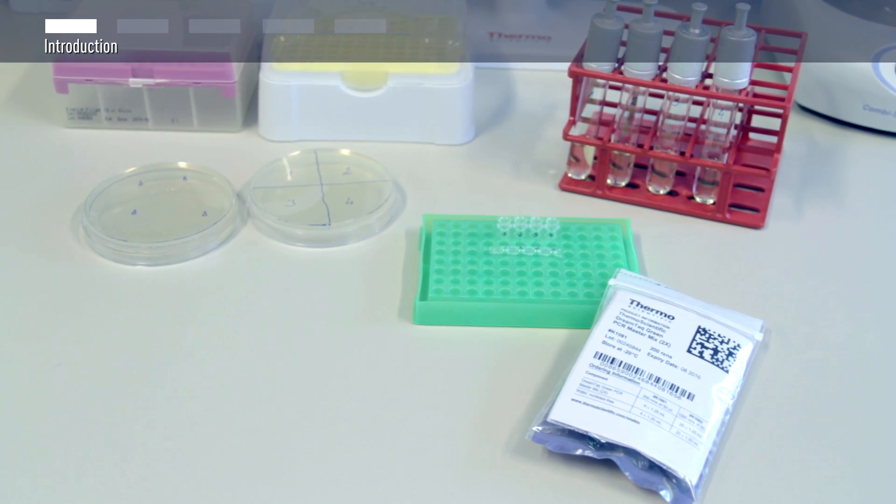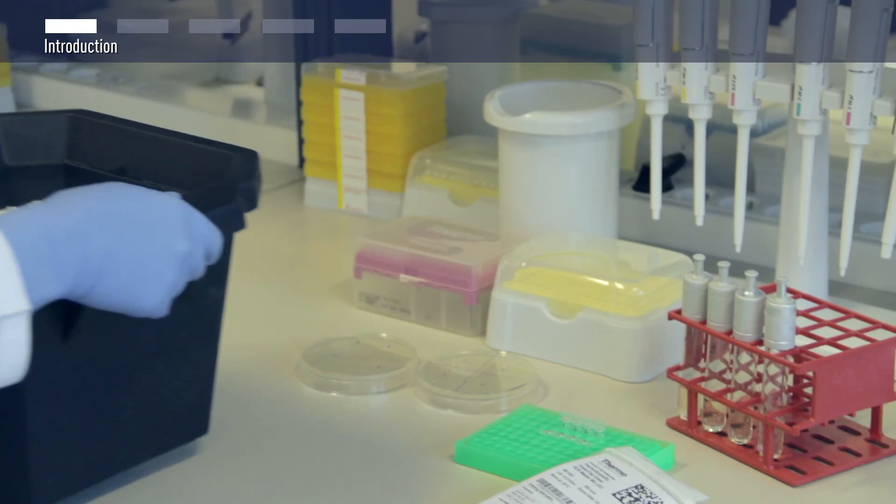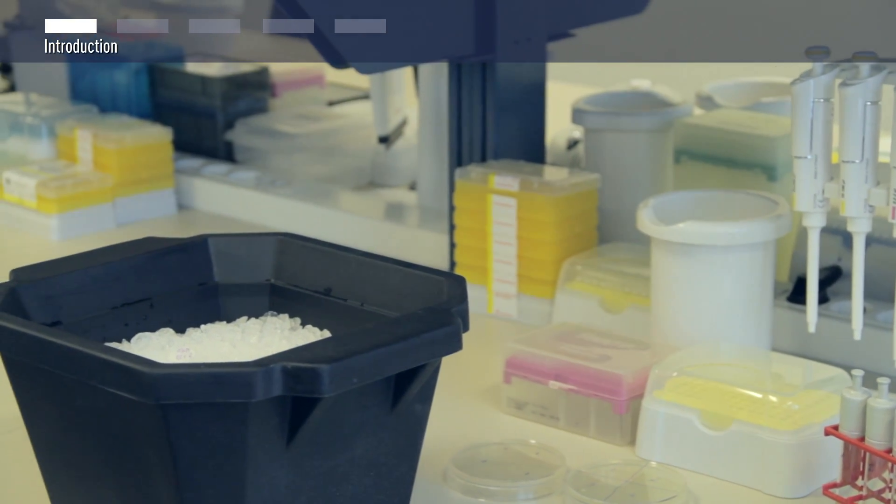In this video we will show you how to do fast and simple Colony PCR with ThermoScientific DreamTaq Green PCR MasterMix.